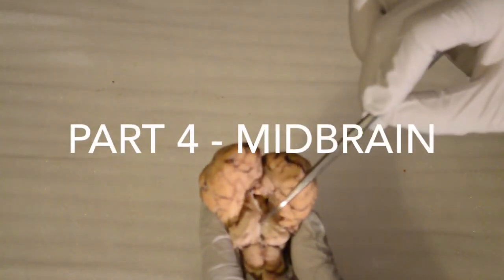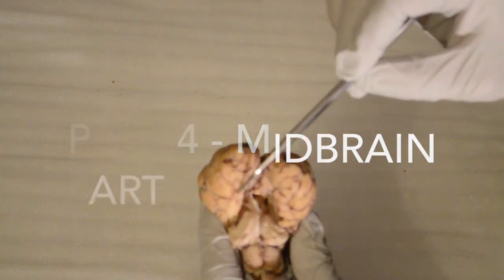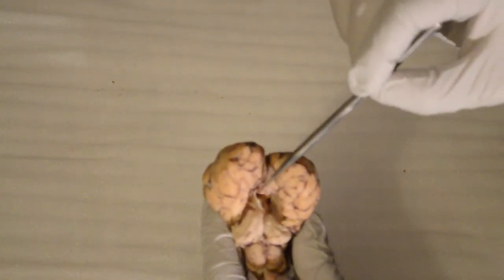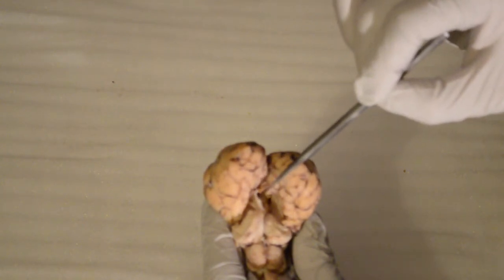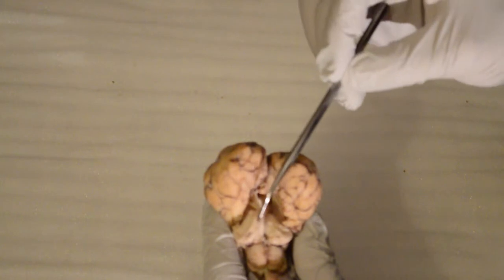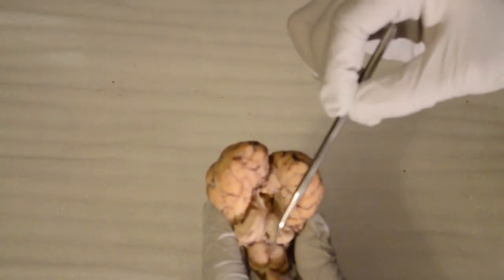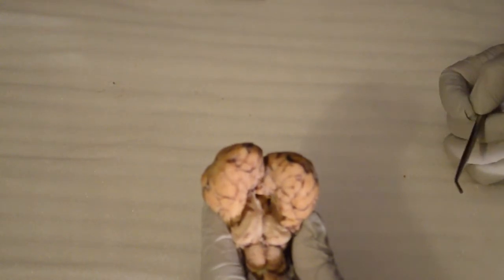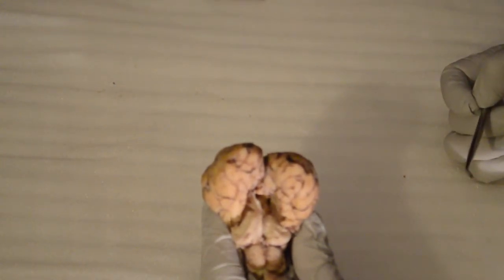And of the midbrain, we want to focus on the corpora quadrigemina, which is the left and the right. We also have the pineal gland, which is sitting right here, followed by the superior and inferior colliculi. This is the superior colliculi and the inferior colliculi. And this is our dorsal deep structures in the brainstem.